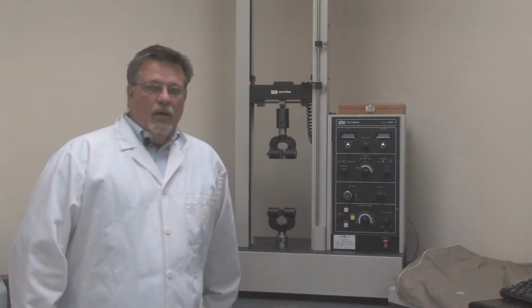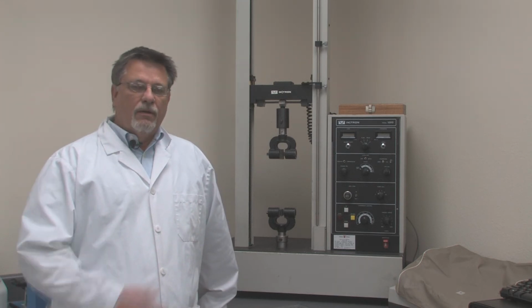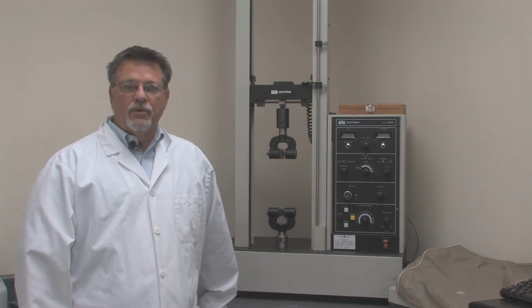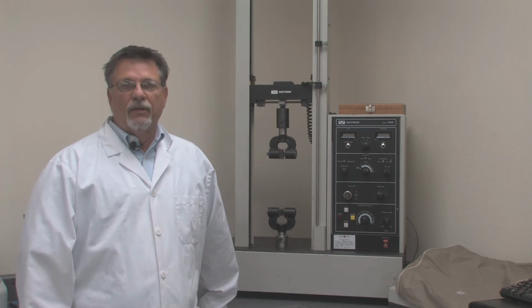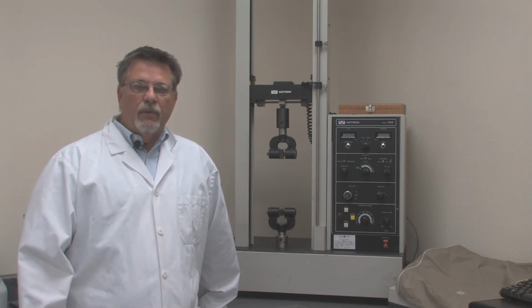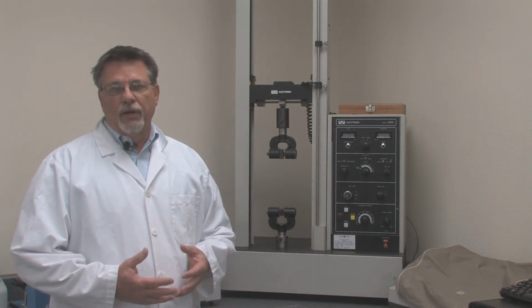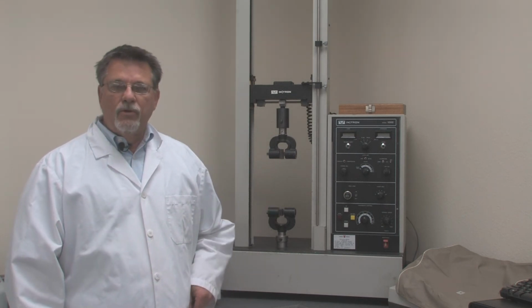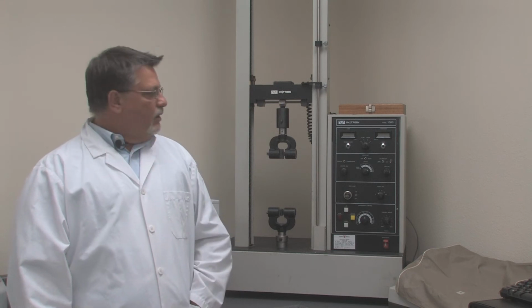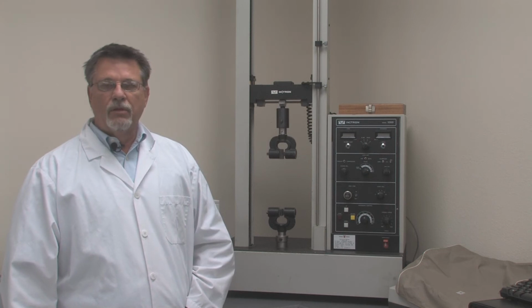We have here in the corner the Beast. This is our Instron. It's basically the same device as our Tinius-Olsen. This particular unit is one that we use to do some special qualification of things like films. We're doing pull testing. When we do adhesive development, for instance, and we want to check for the pull strength of an adhesive with different substrates, the Instron is the machine that we use to do all that qualification work on. It's a workhorse. We've had it for a long time, and it certainly comes in handy when we're doing these special tests.